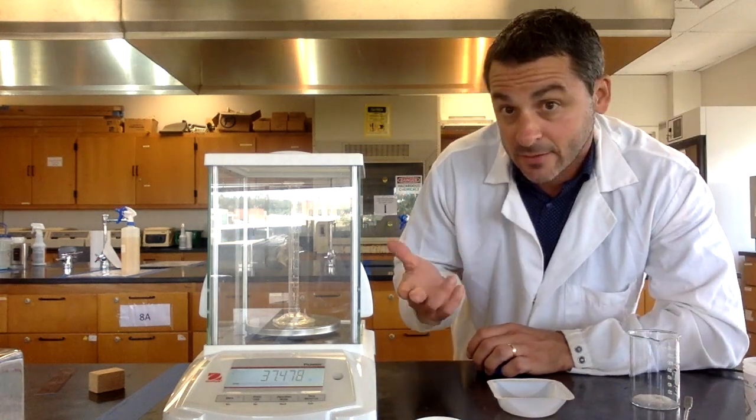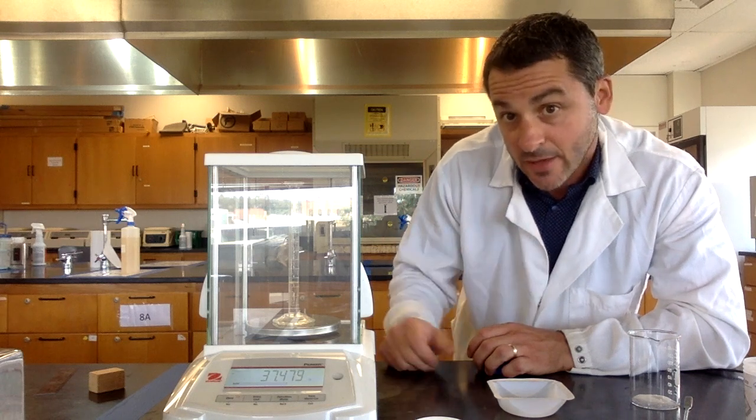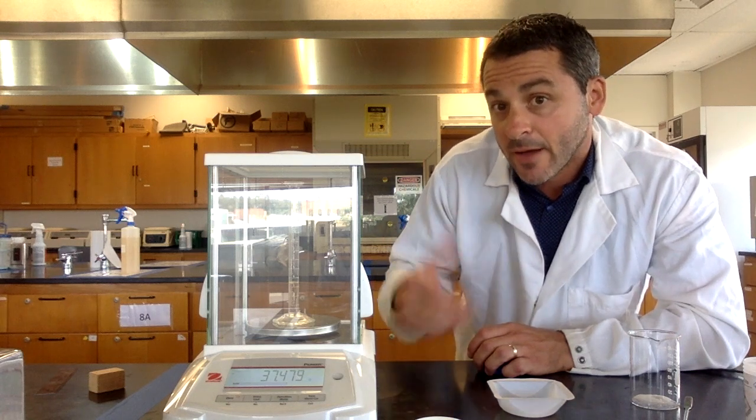Again, I subtract the difference. I take this mass minus the mass of the empty graduated cylinder and that would give me the mass of the liquid inside there.